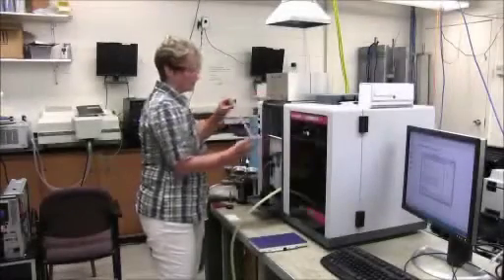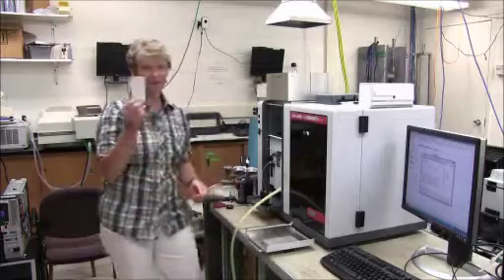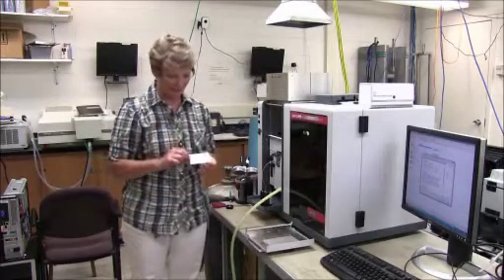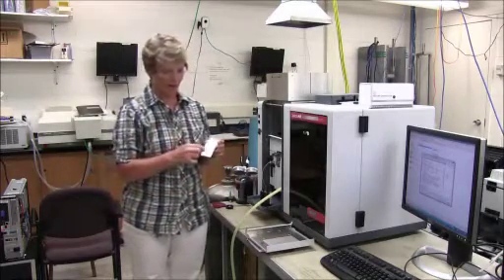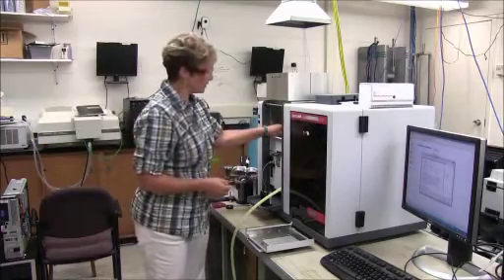With the flame off, the way that you align the lamp is by using what looks like a business card, but is actually designed with a target area that when you hold it in the burner range, you can see that the lamp emission is directly in that target area.